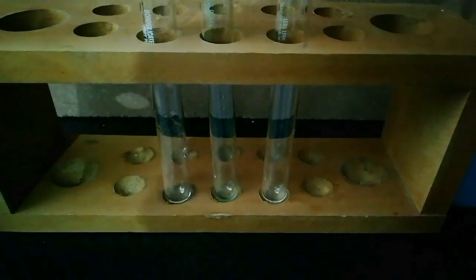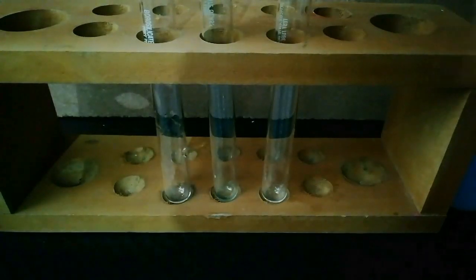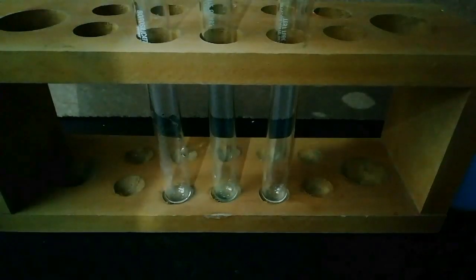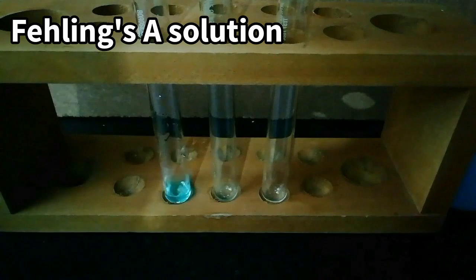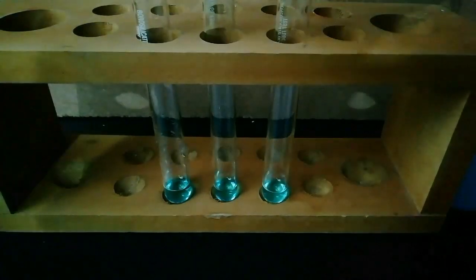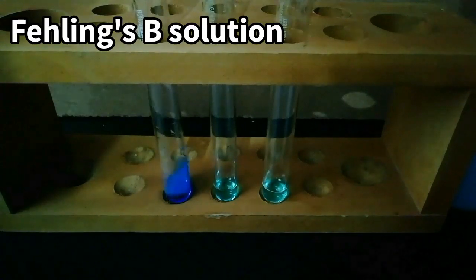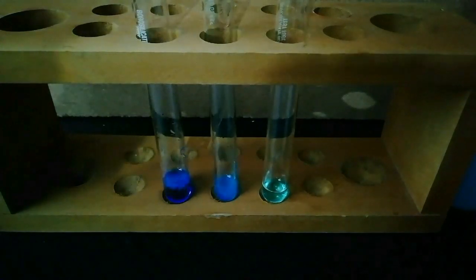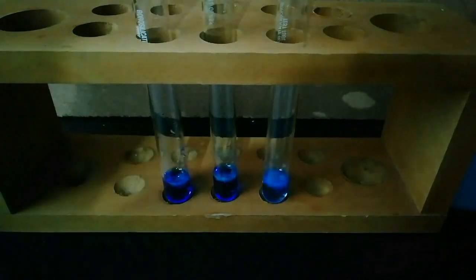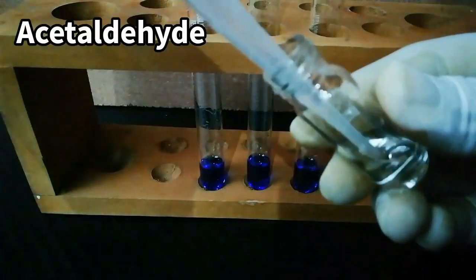Before the test I am going to mix equal volumes of solution A and B. First I add Fehling's solution A to three separate test tubes, then solution B. After mixing both solutions the reagent looks deep blue in color. Now I add the test samples and boil the mixture in a water bath.